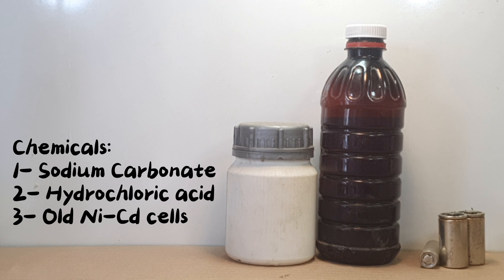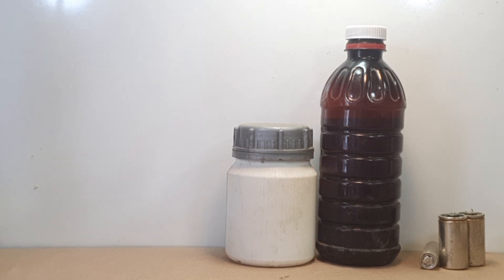The chemicals required for this extraction are sodium carbonate, hydrochloric acid, and old nickel cadmium cells.